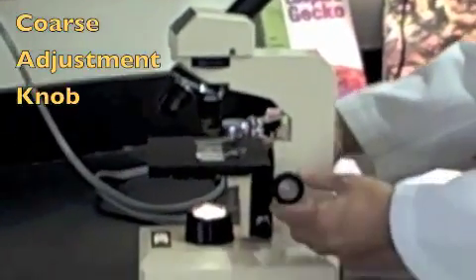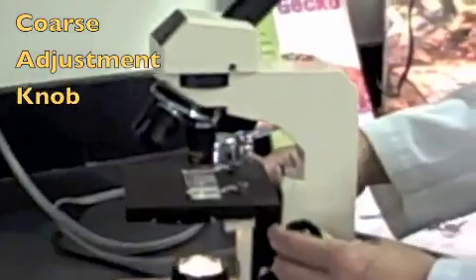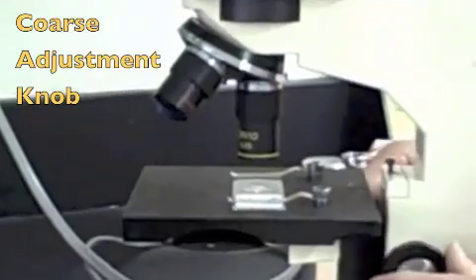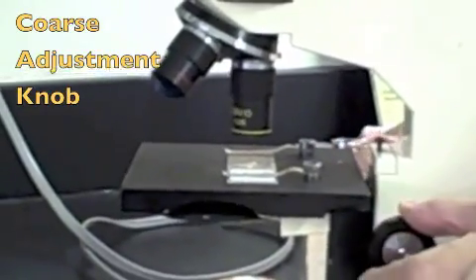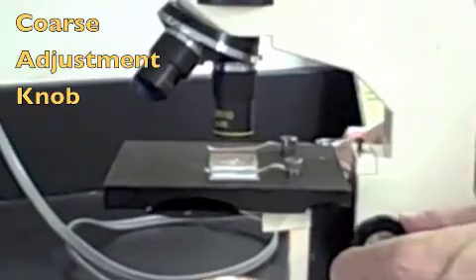If you notice, when I turn the coarse adjustment knob, you can visibly see the stage moving up and down. It moves the stage a lot. It focuses quickly.